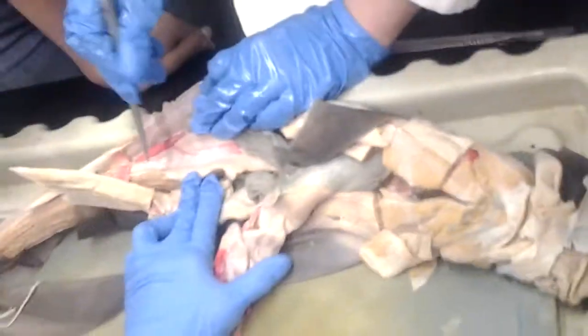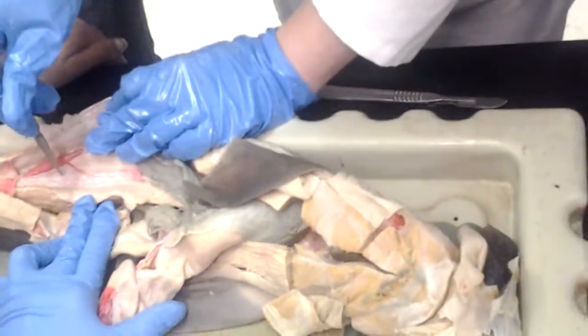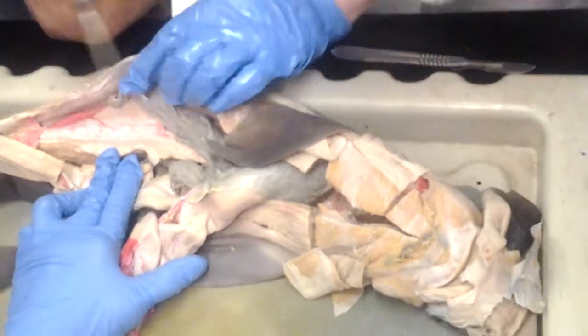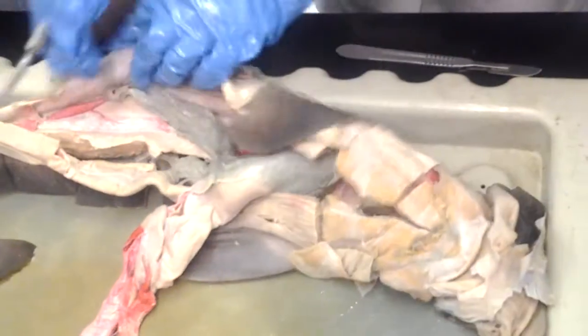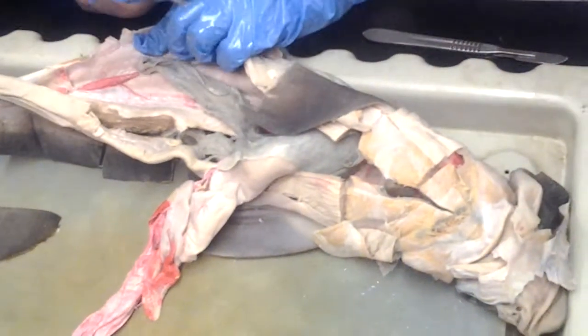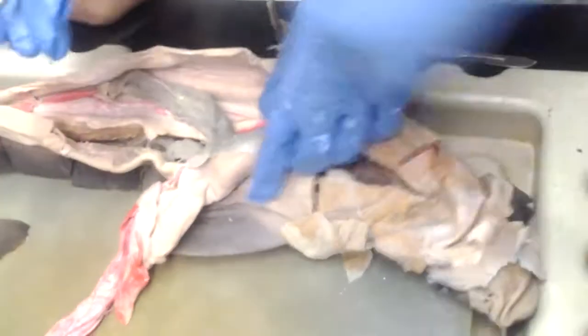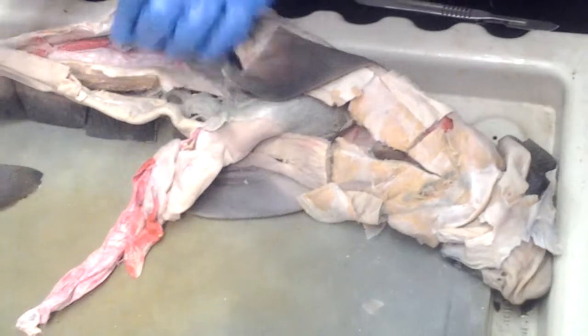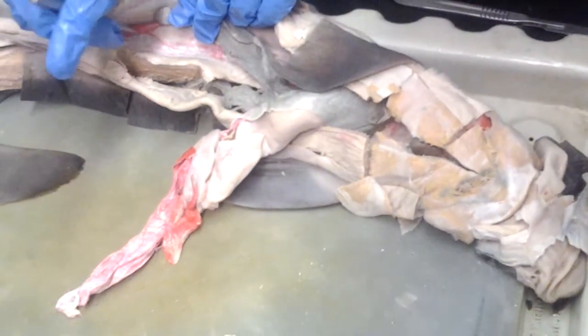All right. So one more time, we got rectal gland here. We got mesorectum and posterior mesenteric artery. So which ones are the hepatoduodenal ligament? Oh, good question. Okay. So we'll get to that in a minute because we're going to do the dorsal mesenteries. So the dorsal mesenteries include the mesorectum.